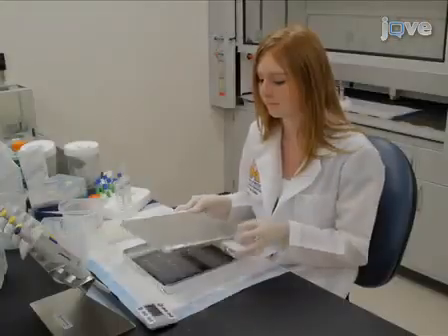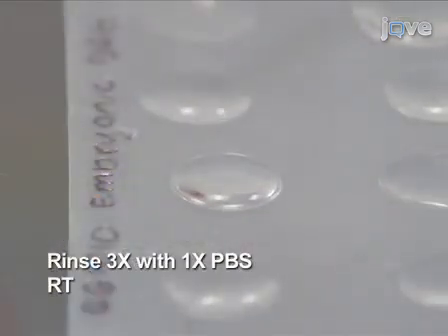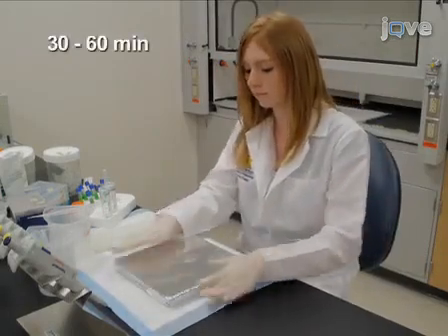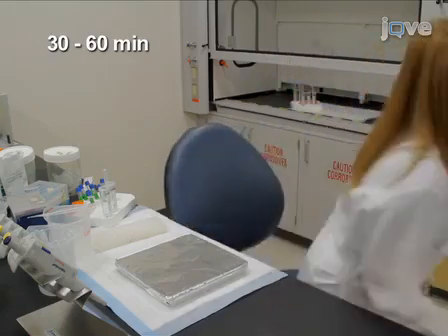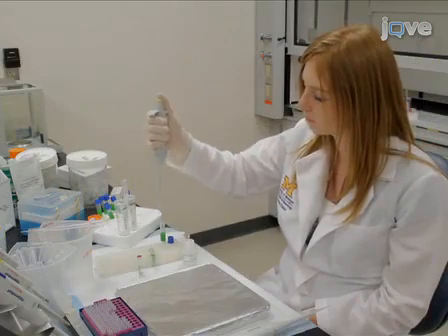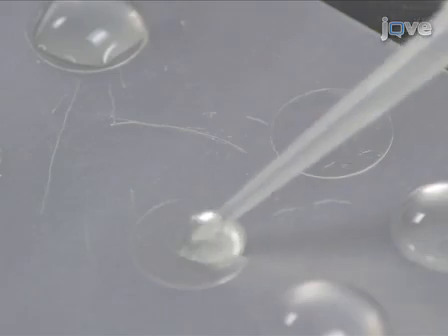The next day, rinse 3 times with 1x PBS at room temperature. Incubate the cover slips in the final wash for an additional 30 to 60 minutes to ensure that unbound primary antibody is removed. Prepare the tyramide reaction according to the text portion of this protocol immediately before use.